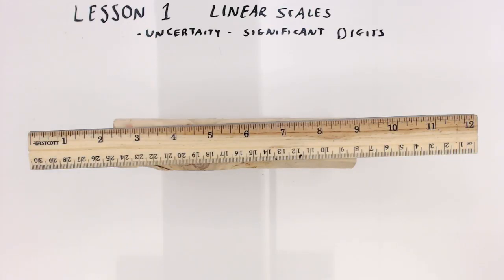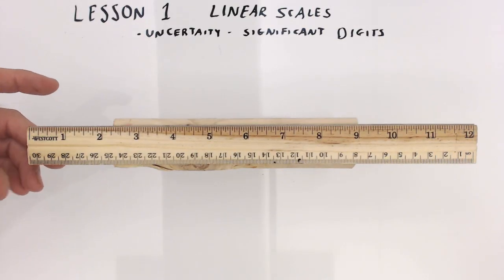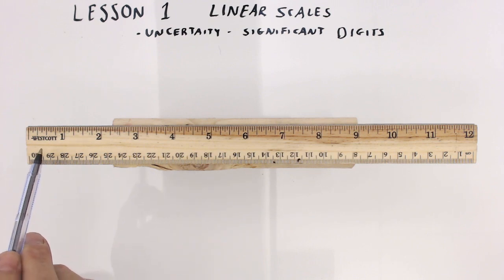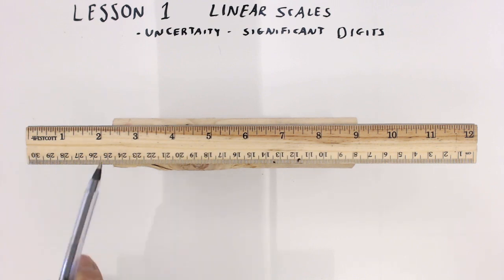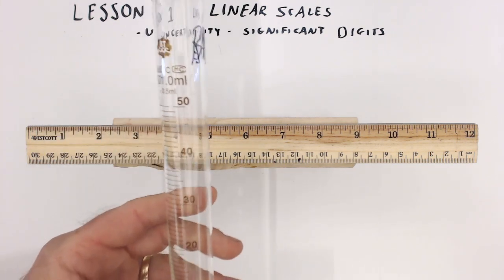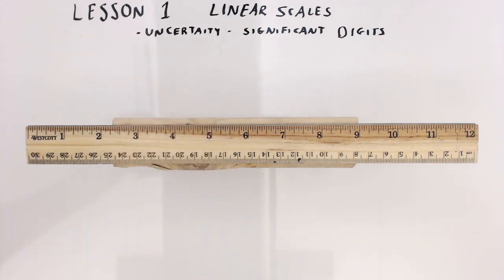So here's our first lesson here in chemistry: how to read a device that has a linear scale on it. A ruler is a device with a linear scale because you can see there's these lines and the spaces between the lines are the same, and so that's called a linear scale. Linear scales occur on many devices. Here's a graduated cylinder with a linear scale, a pipette with a linear scale, and many other things that we're going to use this year.